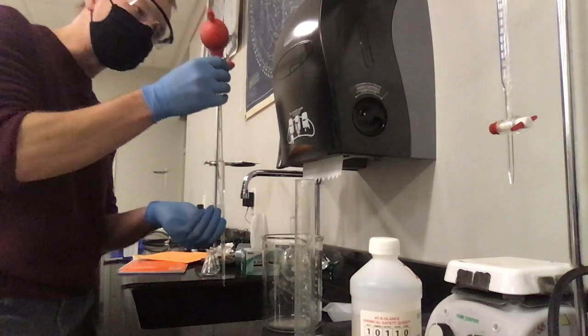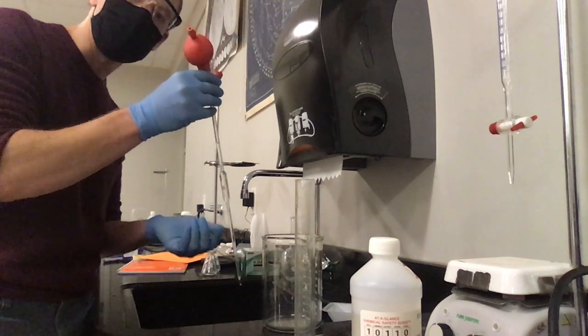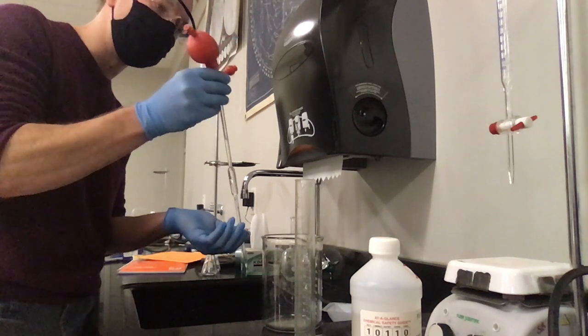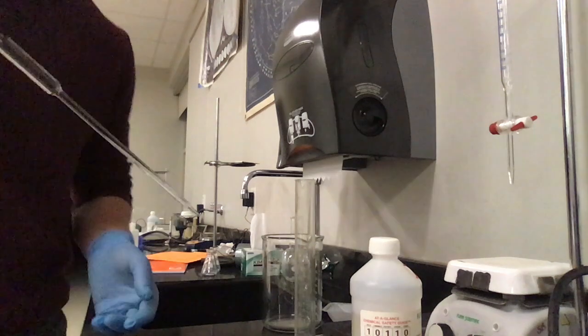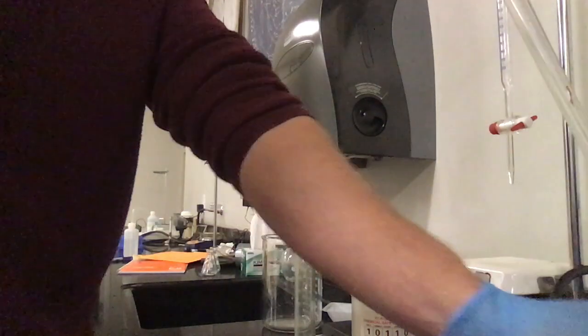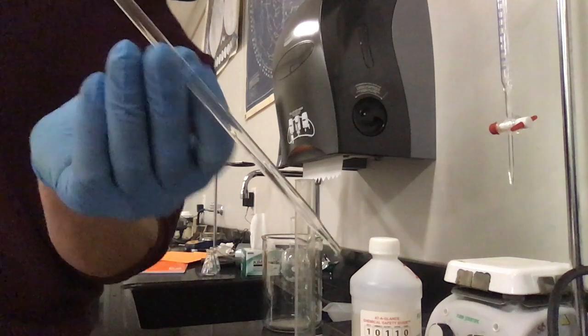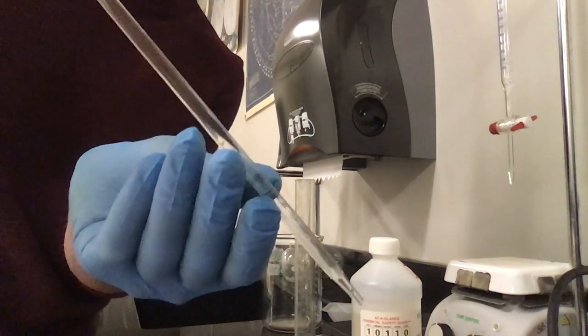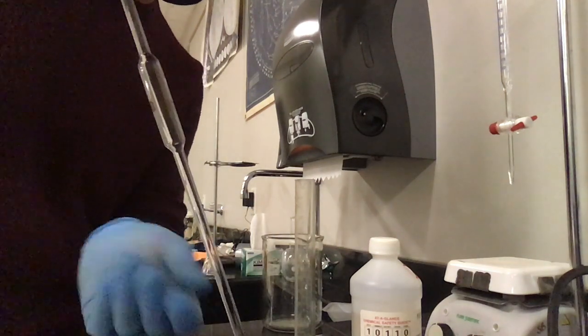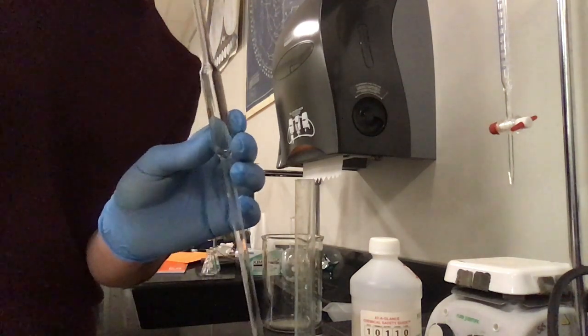All right. Let's, I think I might just be a teeny bit over. So what I'm going to do, I'm not actually going to empty it because I nailed it. But I would empty a tiny bit over the sink. I would never empty it back into my container in fear of contaminating the container of my unknown acid.